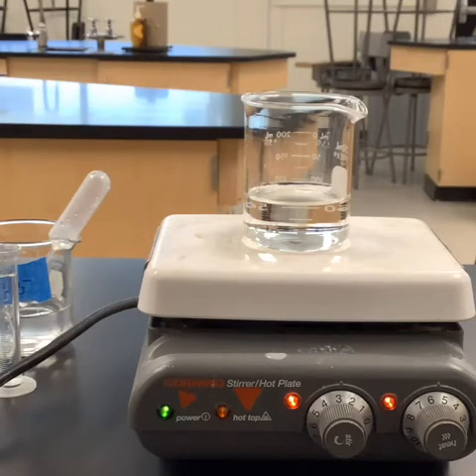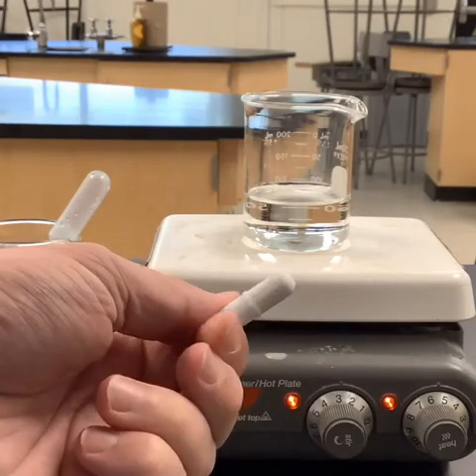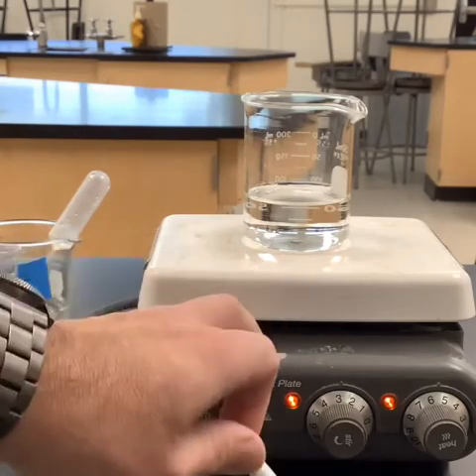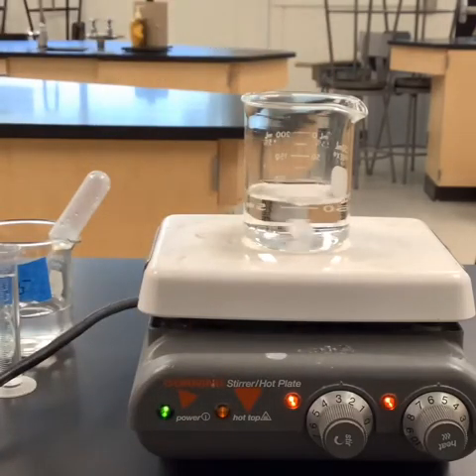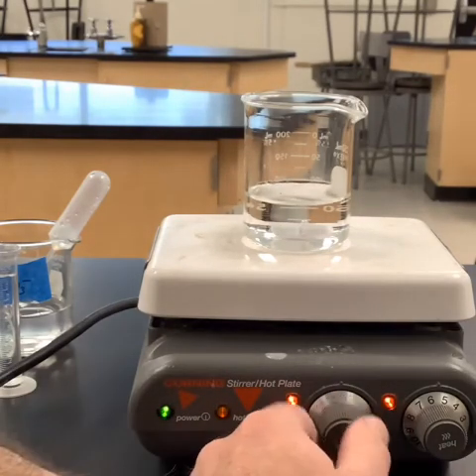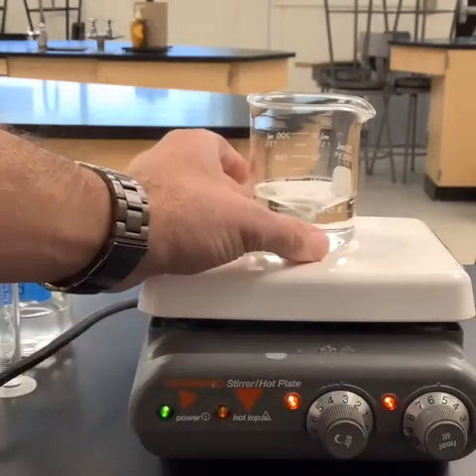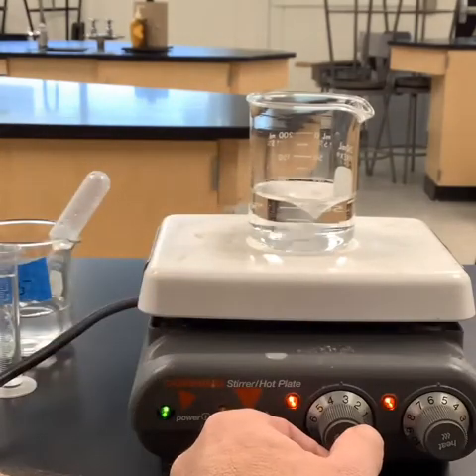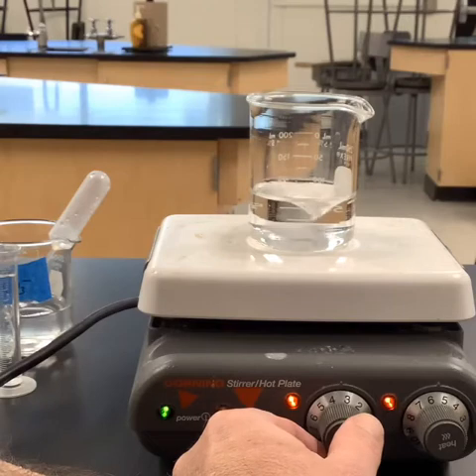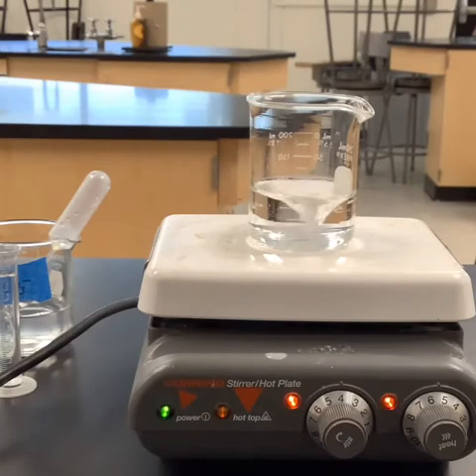So to help me out with that, I have this hot plate, but you'll notice it says it's a stirring hot plate. Some of you might have seen this before. This is basically a magnet that is covered in plastic, and then there's a magnet inside of here. So if I put this inside, you'll see that it's stirring, right? I can turn it off and it'll stop stirring, or I can turn it on and pick whichever speed that I want it to go. So let's find a good speed for us to use here. Kind of clanky, but that's all right. I think right on 4 looks pretty good here. So we're gonna leave it on 4.